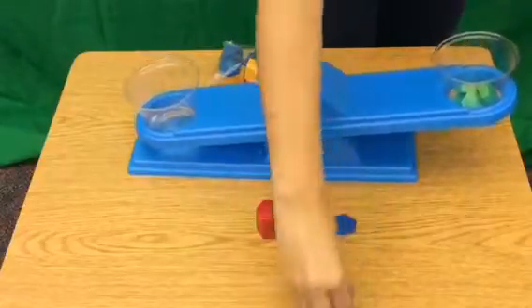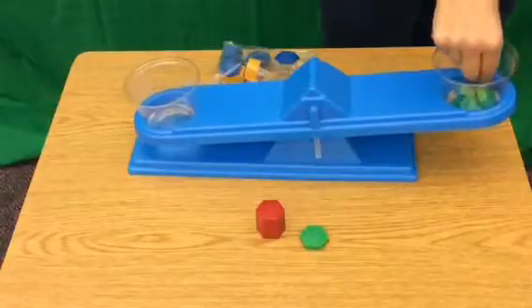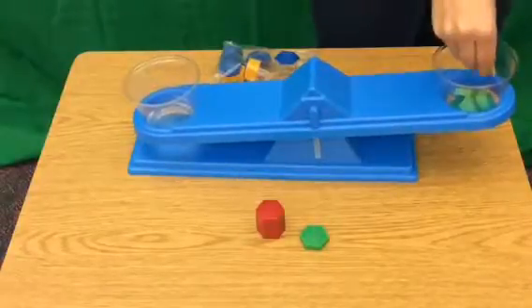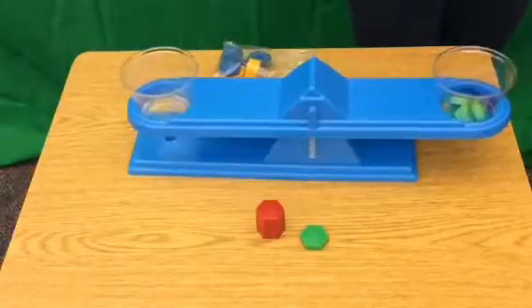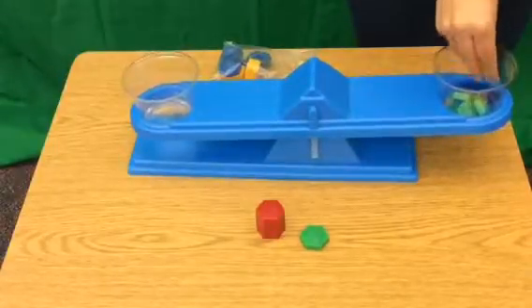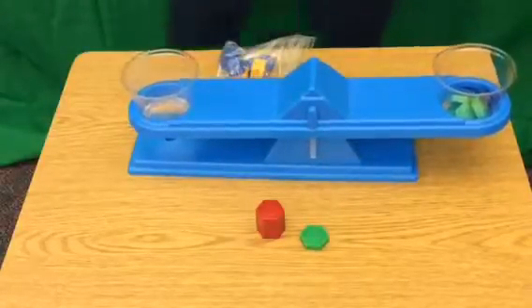It's going to start, so maybe I'm going to go with the 1 gram pieces now to see. So there's 21 grams, 22 grams, ooh, it's getting close, 23, 24, ooh, I think I'm going to wait and see once it stops shaking.